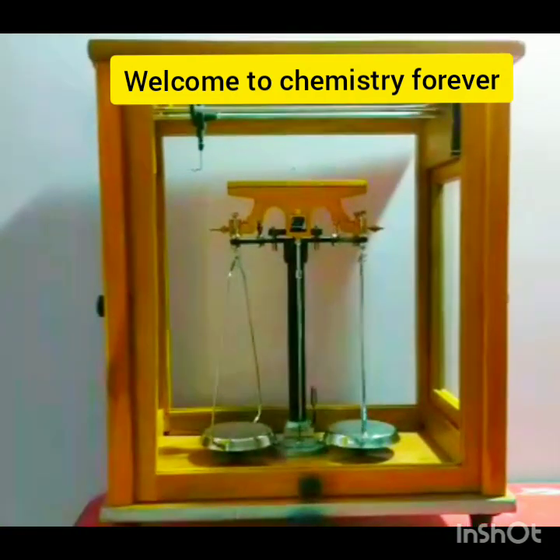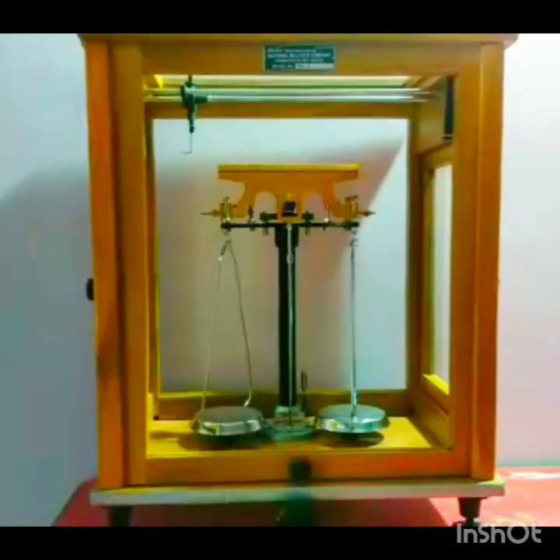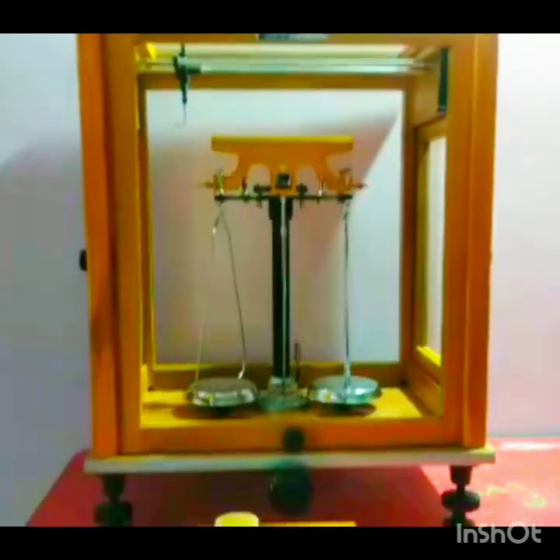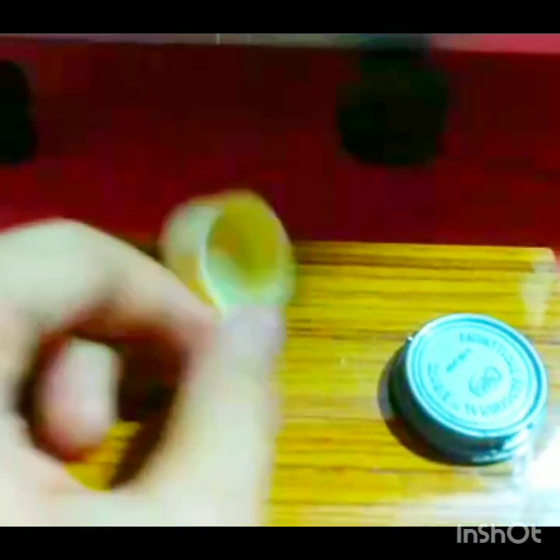Hi everyone, this is Chemistry Forever, and today I'm going to show you how you can measure the weight of any object on this chemical balance. For that, you will need an object whose weight is to be taken.